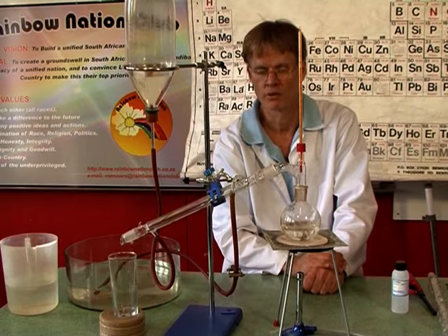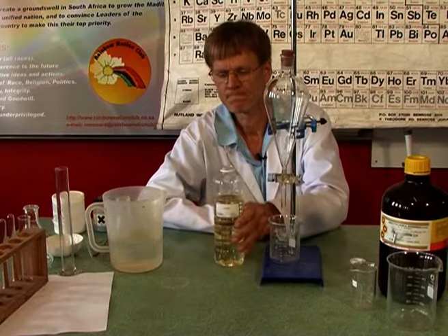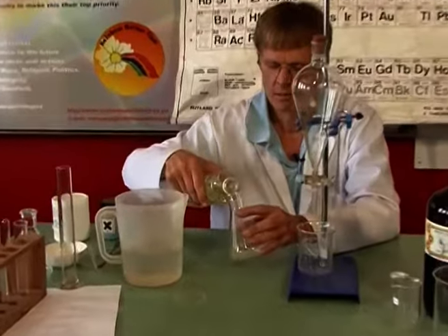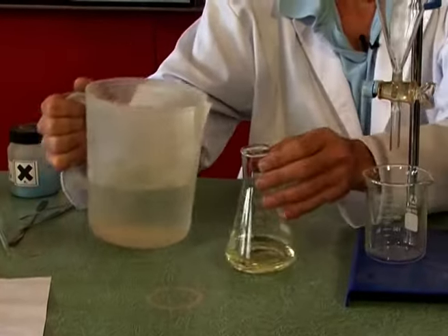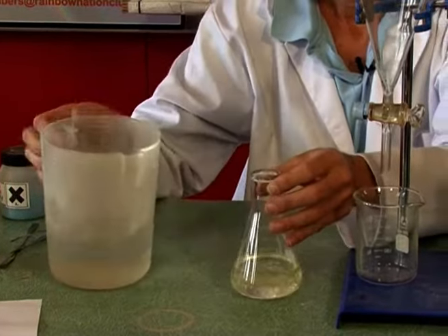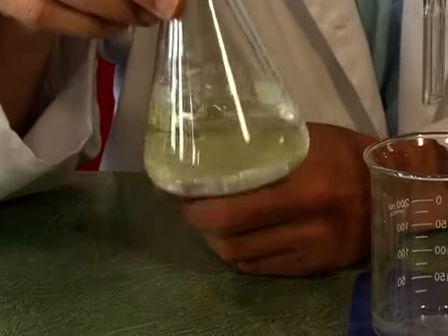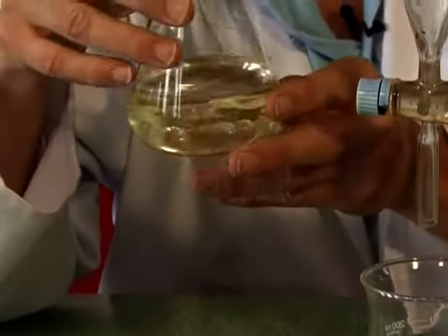Right, here I have some paraffin and some water. I'm going to make a mixture. It's 2 liquids this time. Put some paraffin in there and put some water. And if I shake it up, you might be able to see it makes what we call an emulsion. Now, how are you going to separate it?